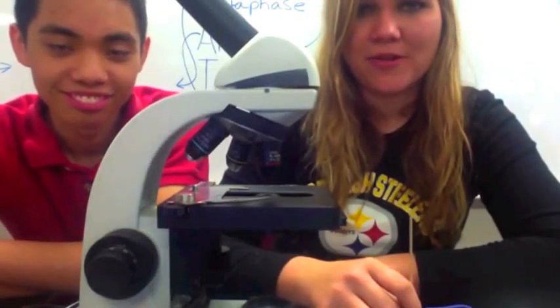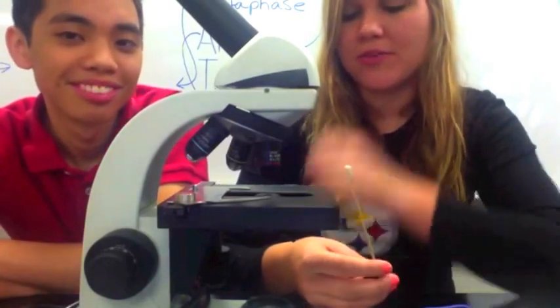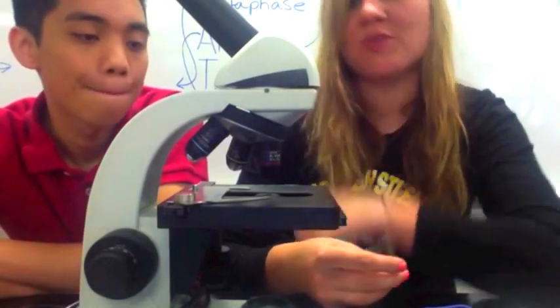This is part three of the review for your first lab exam. In this video, we're going to be showing you the different parts of the microscope.